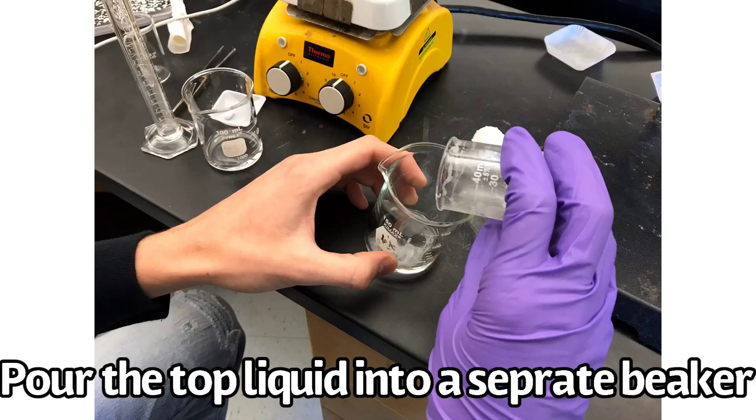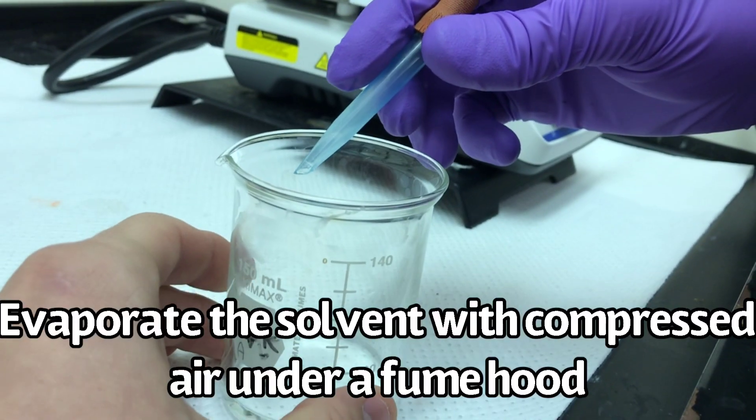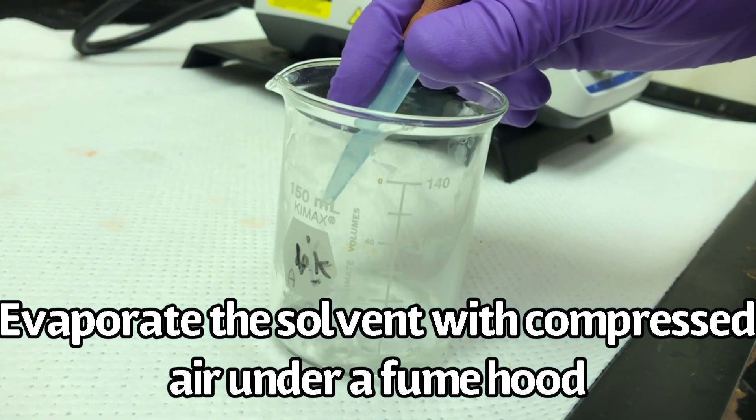Pour the liquid into a separate beaker. Evaporate all the solvent with compressed air under a fume hood till no liquid remains.